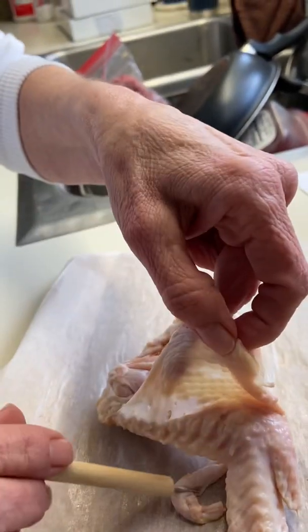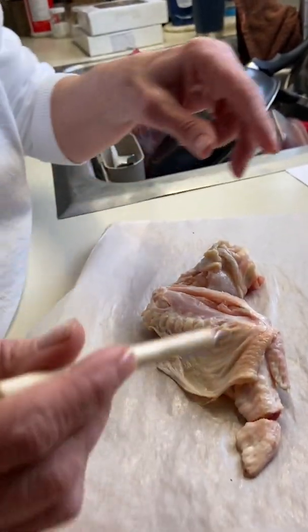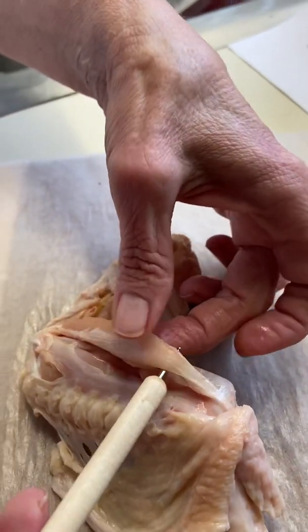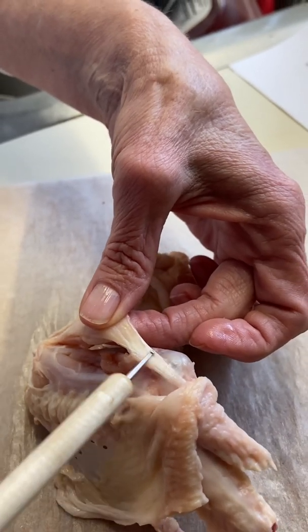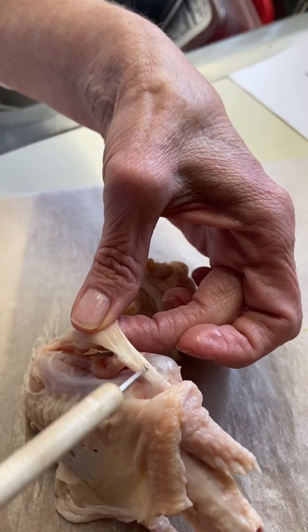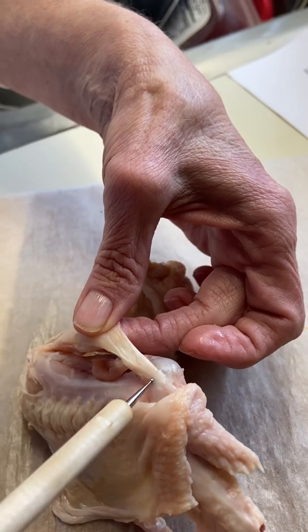I'm just going to roll that back here and move on to look at identifying our tendon. Our tendon is a structure that connects muscle to bone, and right here, this white fibrous and very strong membrane-like tissue is actually connective tissue that would connect muscle to bone. So that is our tendon.